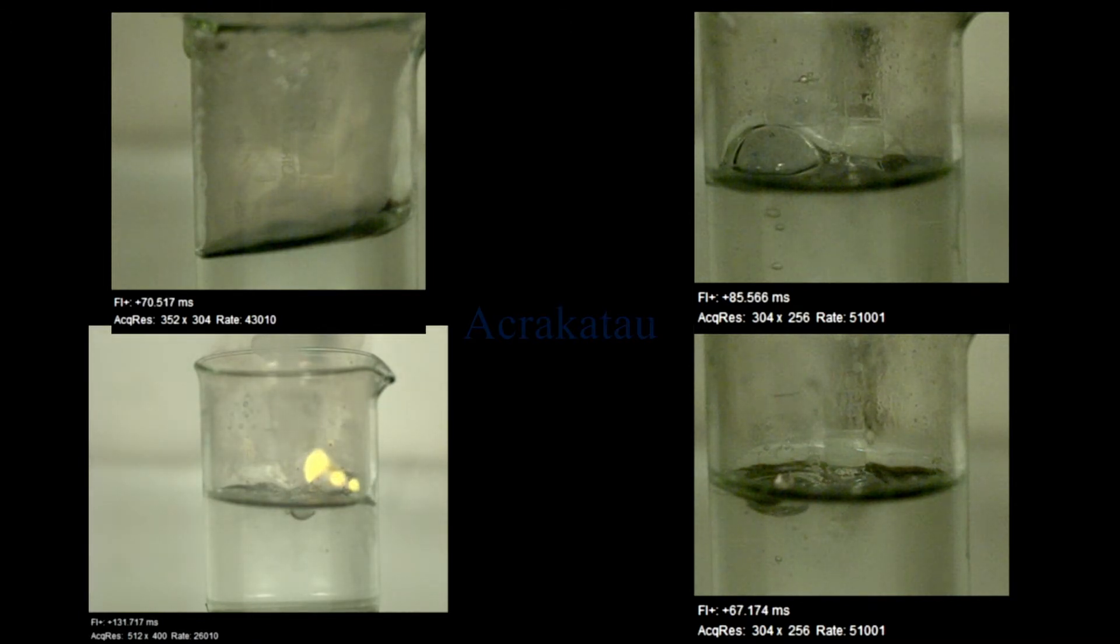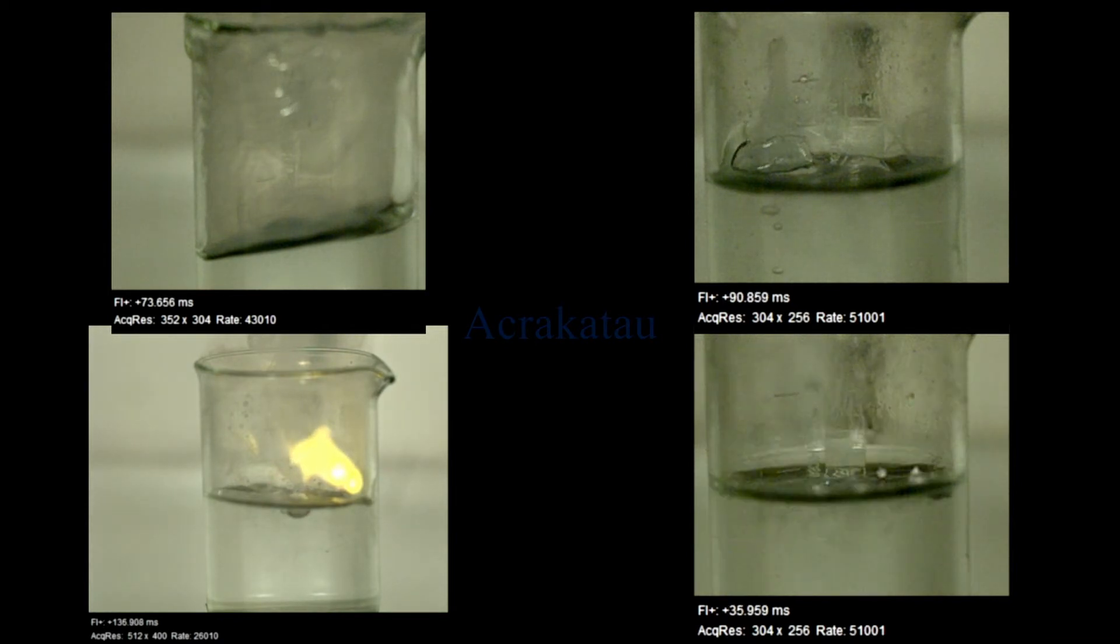So if you see this in real time, you can't really say if the sodium explodes first or the hydrogen. You can only now see it in the high-speed footage.